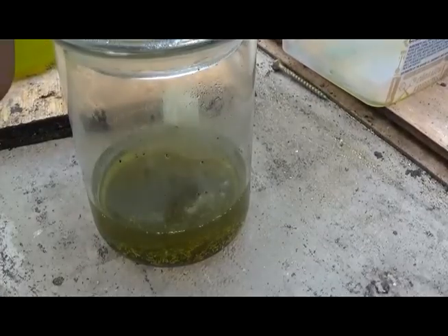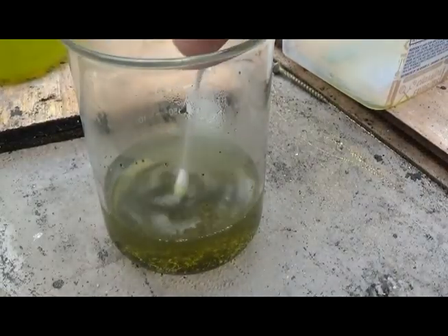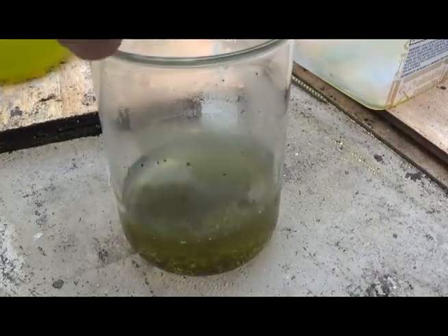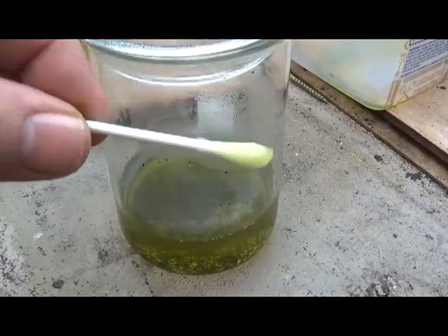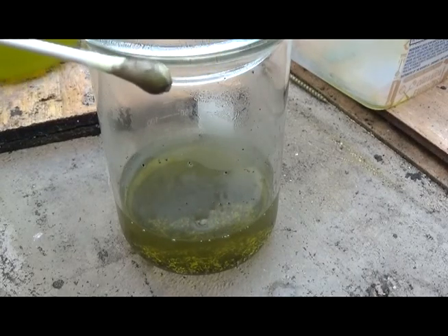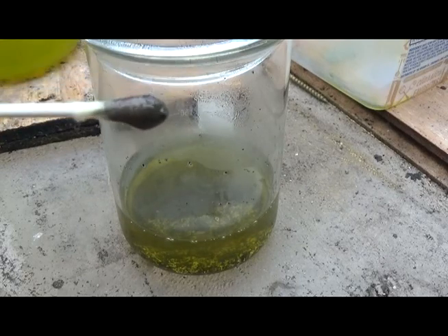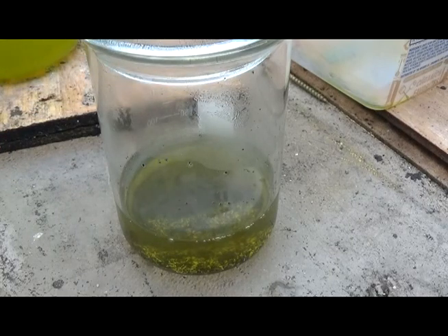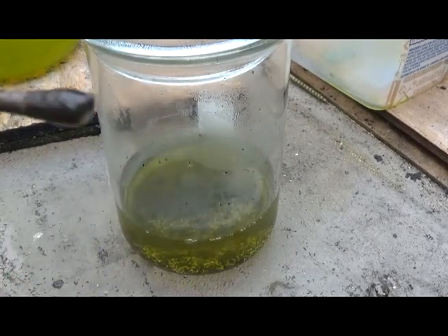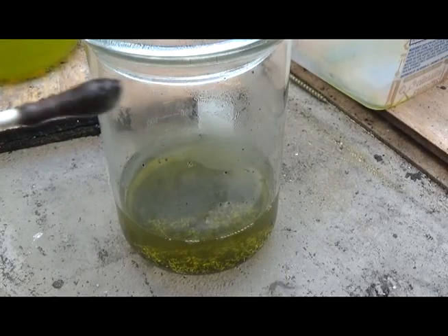The reaction has been great and it's still going. Let's test this with stannous chloride and see if we have a golden solution. High concentration of gold — that black powder down there was gold. It was falling out of solution; something was pulling it out. Hopefully it doesn't happen again, but that's a super concentrated gold solution already and it's still reacting. My theory was partially right — you can see right there, that's gold.